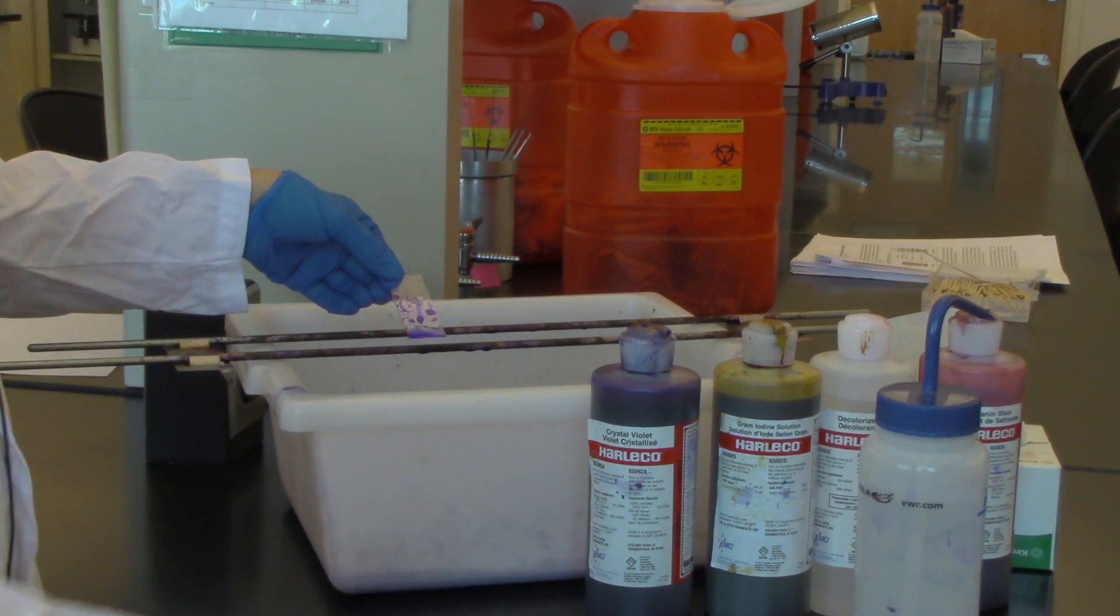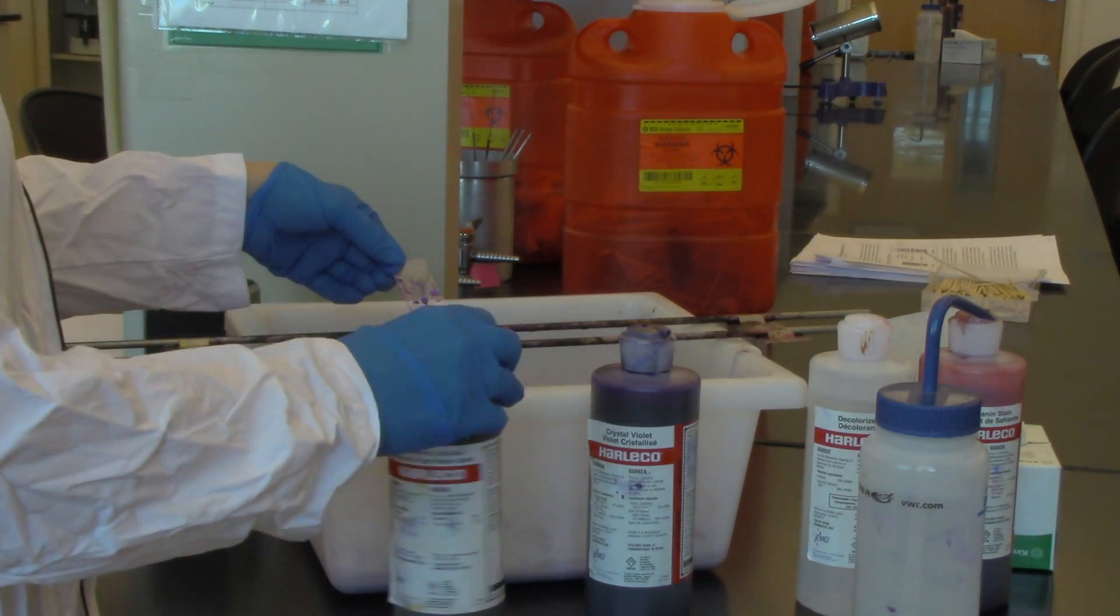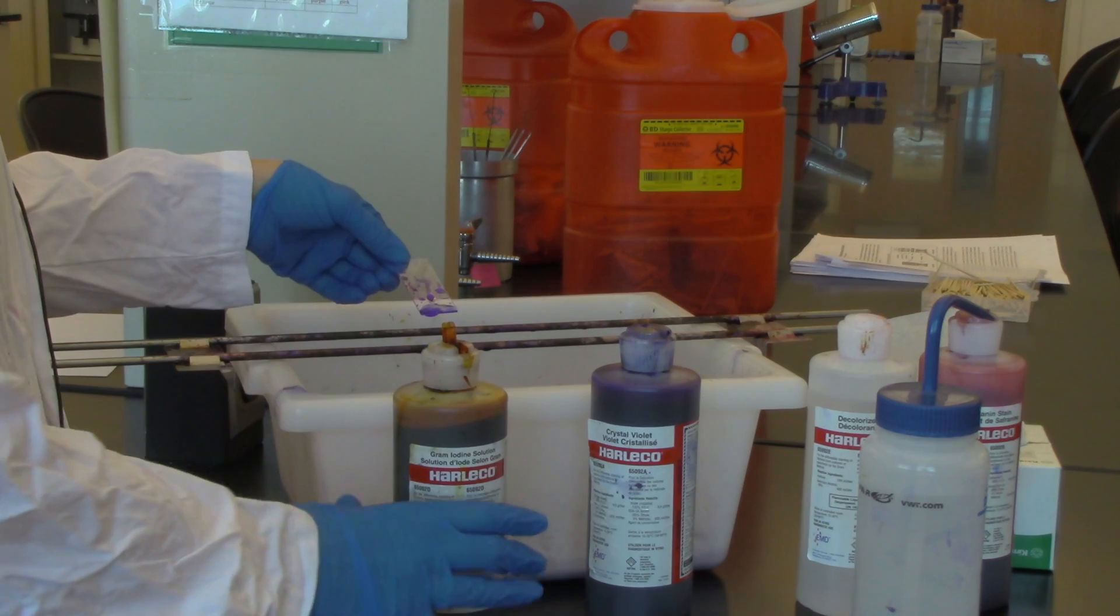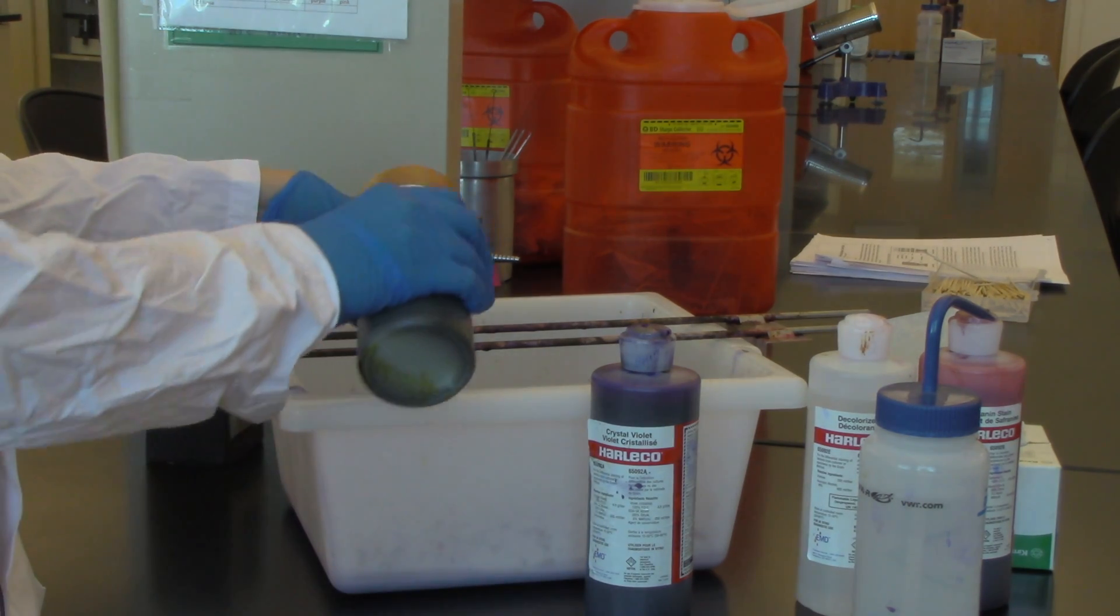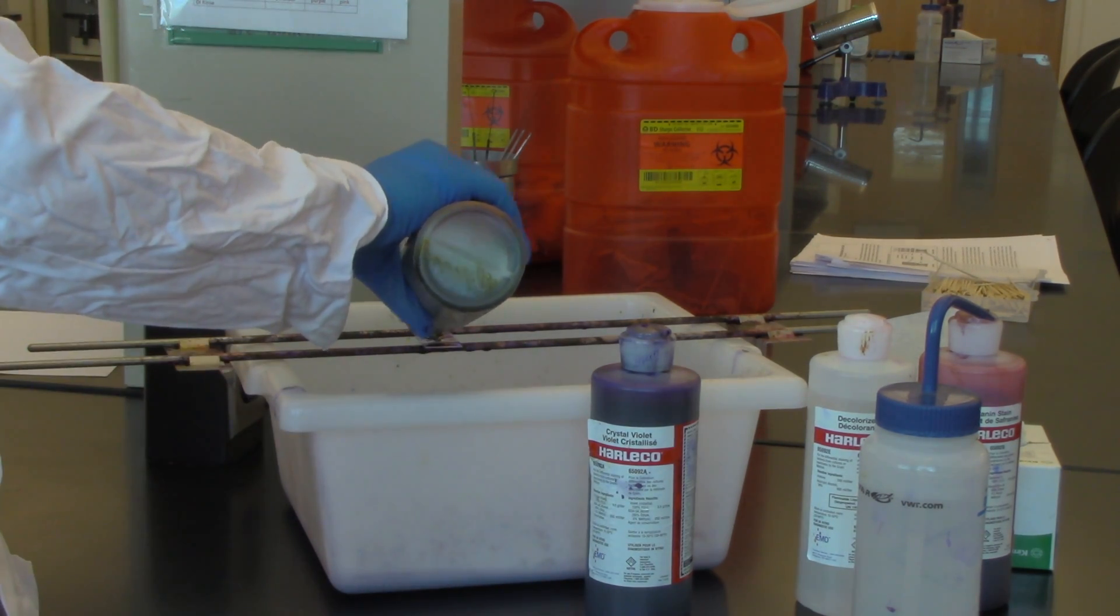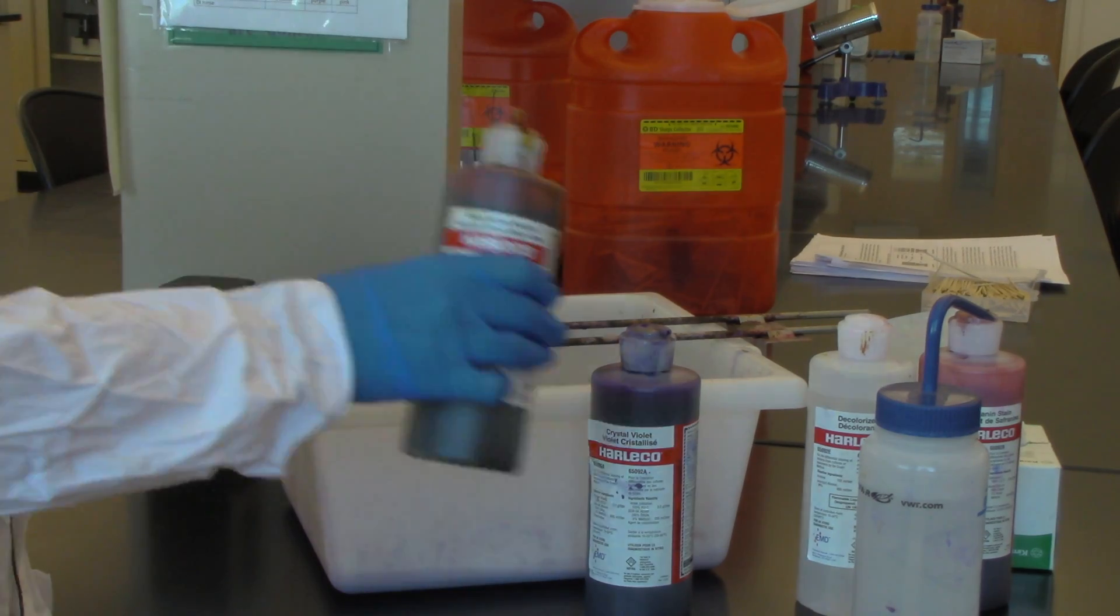Now I'm going to go on to the next step which is add the mordant, and this mordant is called gram's iodine. I'm going to flood the slide and leave it for 30 seconds.